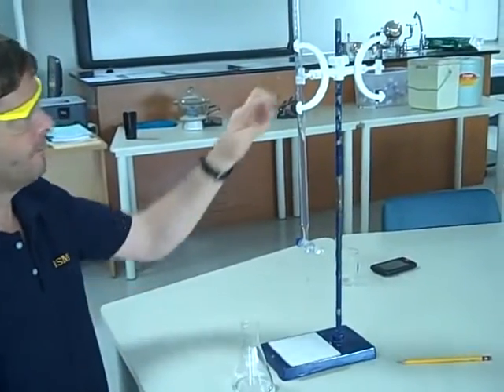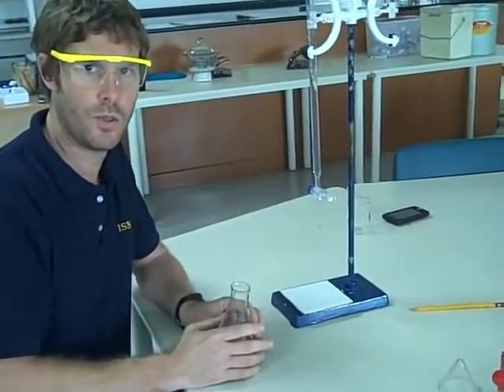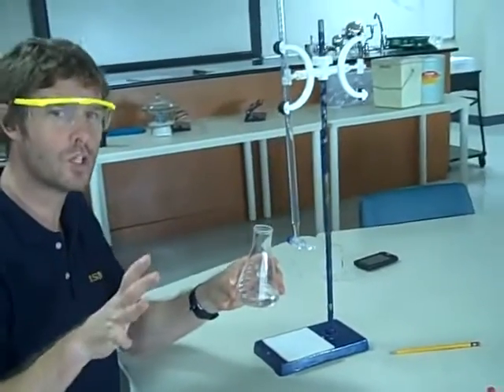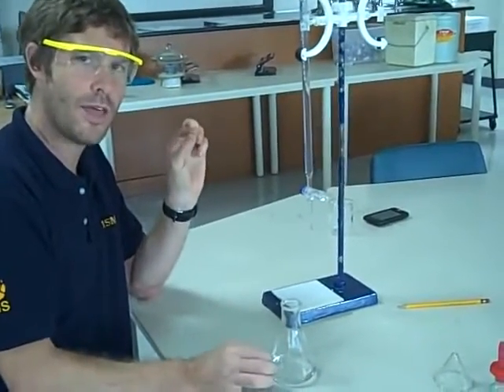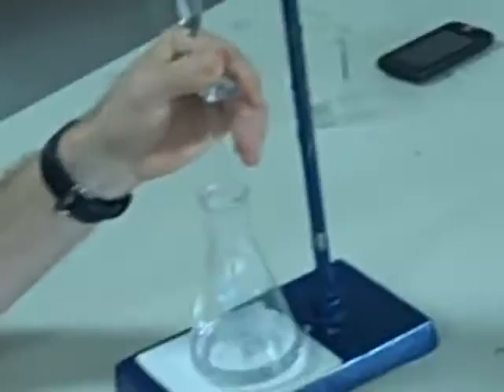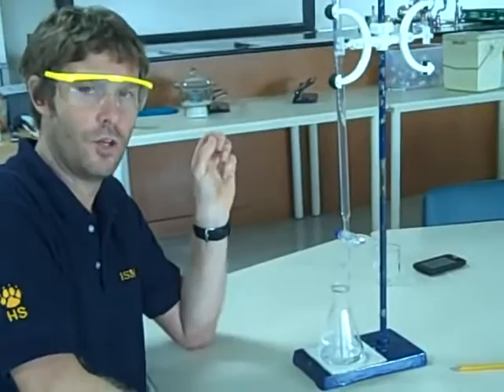I'm then going to repeat the whole process — fill this up again, empty it, wash it thoroughly with tap water and distilled water, add another 25 cc's of my sodium hydroxide with the pipette, and repeat the process. But this time we've got a nice rough value, so we know approximately how much acid was required to neutralise the base. Next time I can add the first 80% of that volume quickly, but as I get closer to the end point I'm going to start adding drop by drop, because we should be able to get to a point where just one drop changes the colour from pink to colourless. Repeat that process until you get about two equal results for the volume of acid added.